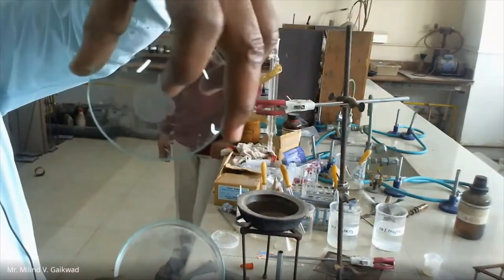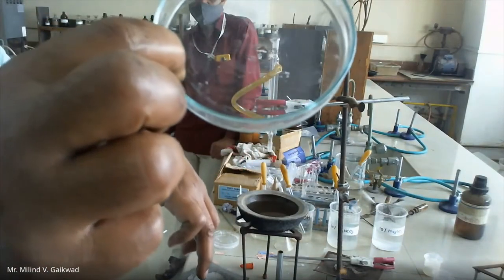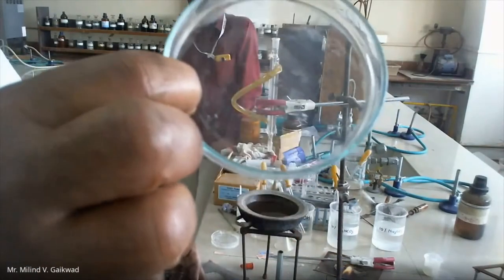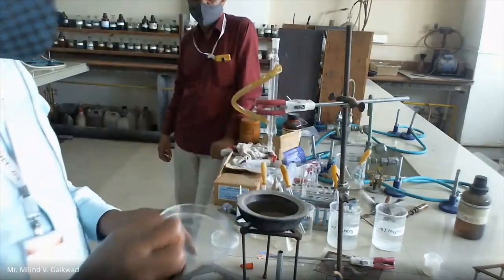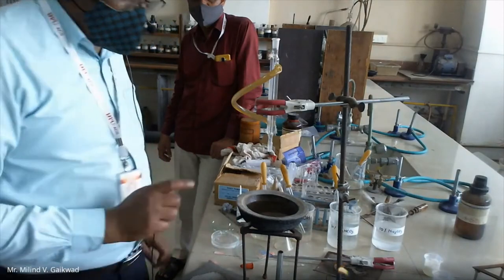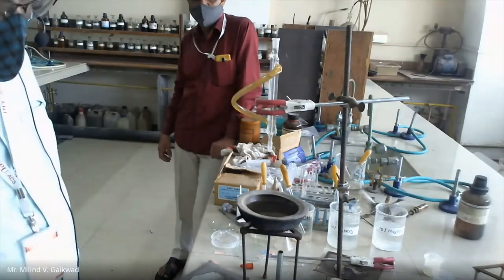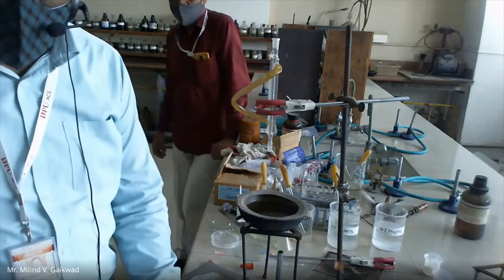In the previous case you are having such type of solid particles, but in this case you are not having solid particles even after putting it on the wire gauge. In the previous one, just you put the drops and you get solid particles. So you can say, as it is a liquid, it is a liquid-liquid. So the first step is the nature — it is liquid plus liquid. When the nature is solid plus liquid or liquid plus liquid, the second step is separation.